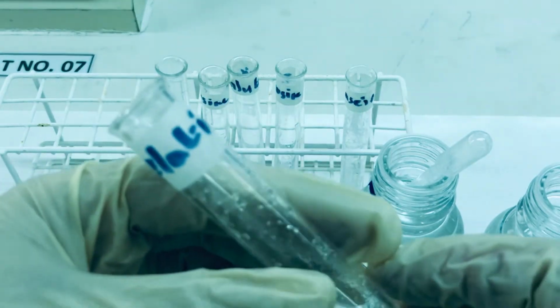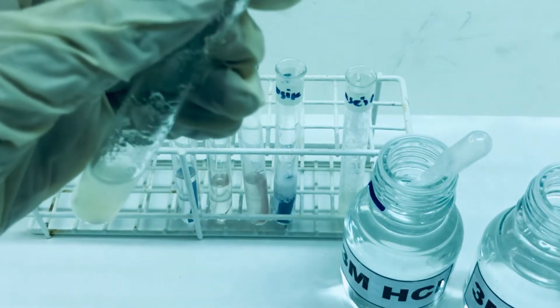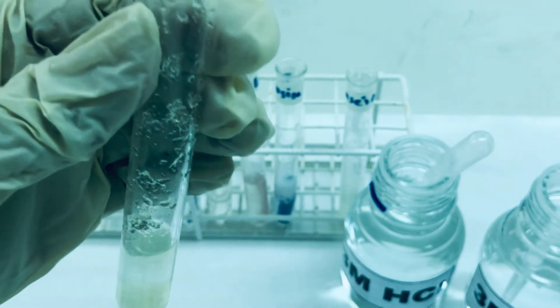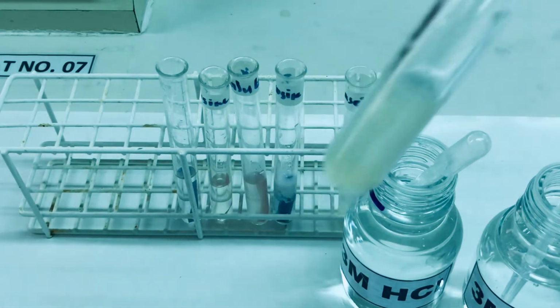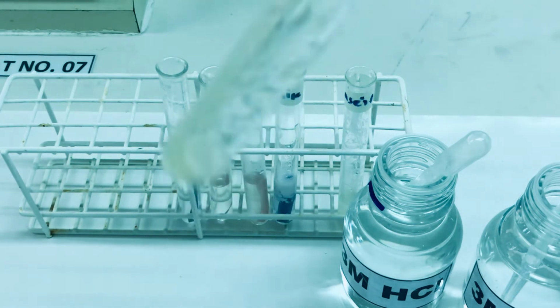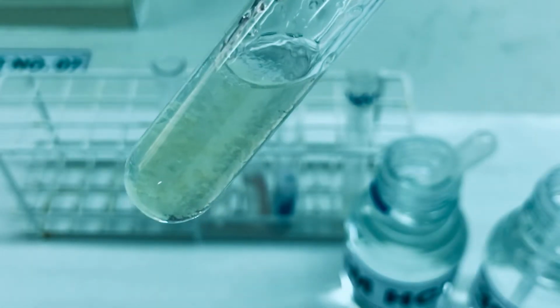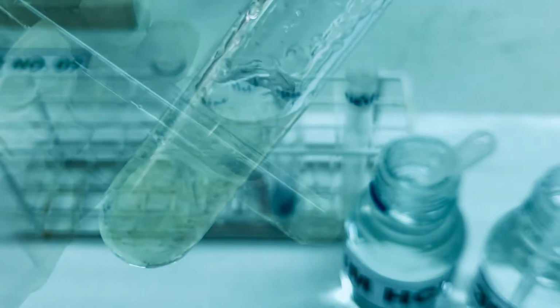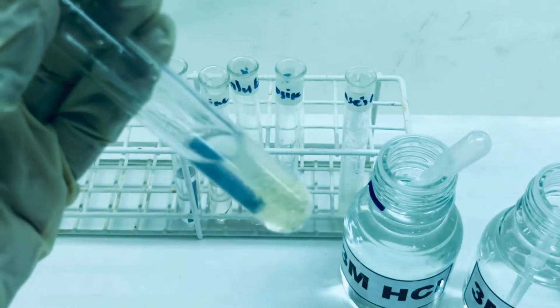For the gelatin suspension, we saw that it was insoluble in water. To this again we will add 1 ml of NaOH, and we are going to put the stopper and shake it vigorously to see if it becomes soluble as a function of pH. You can see that it has become slightly more soluble, or gradually it is becoming soluble. Even after addition of NaOH, the protein still seems to be not soluble.